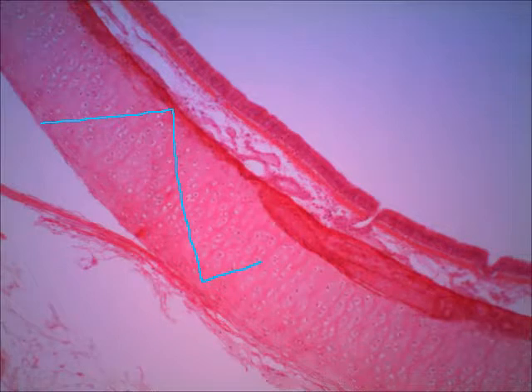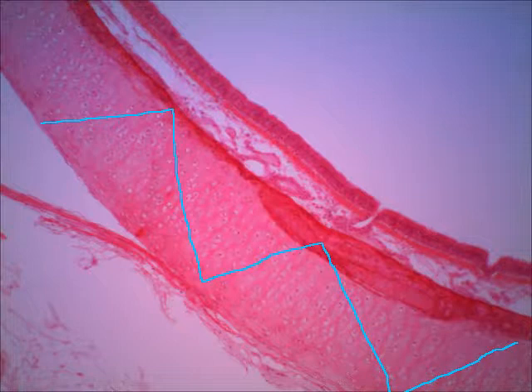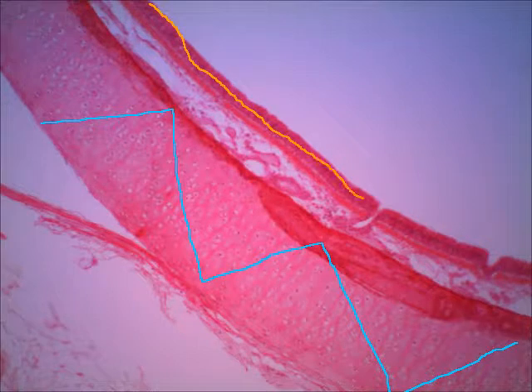Did you pick out this area? All of this is the cartilage. Now, what about the epithelium? Can you see that? This would be the area of the epithelium. Here you can see one of these glands coming up through the epithelium to release the mucus into the lumen, because you've got a lot of mucus that lines the trachea, and that helps to trap any foreign particles that might be in the air that's coming through.